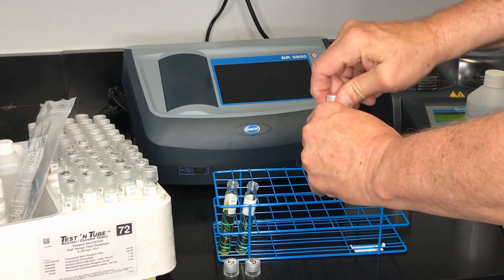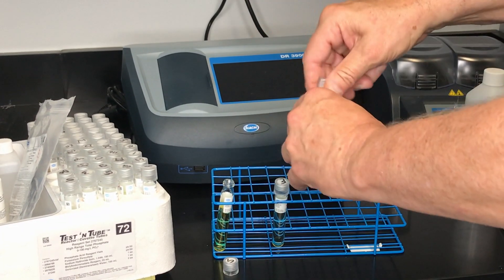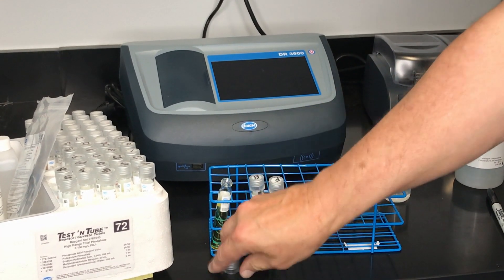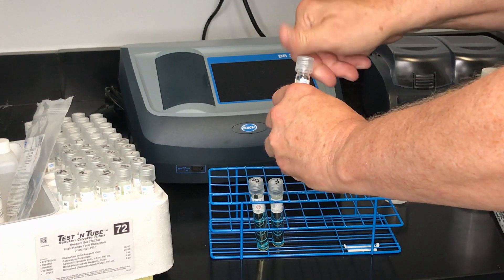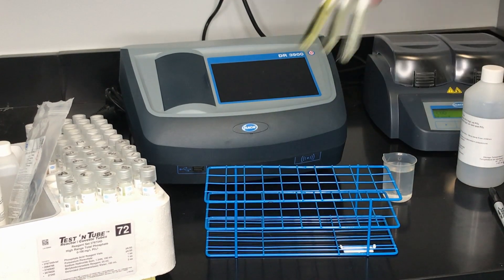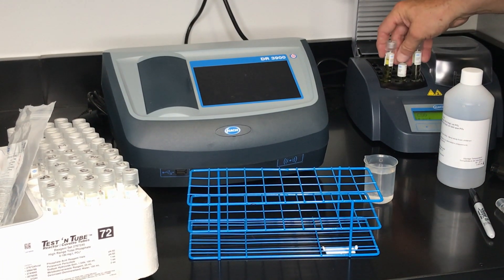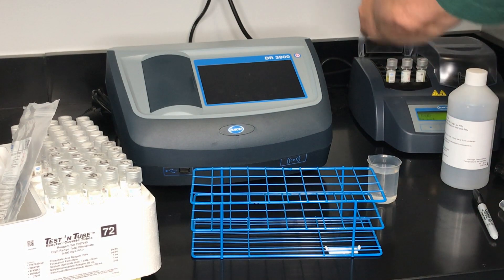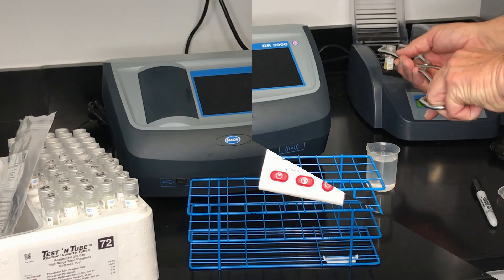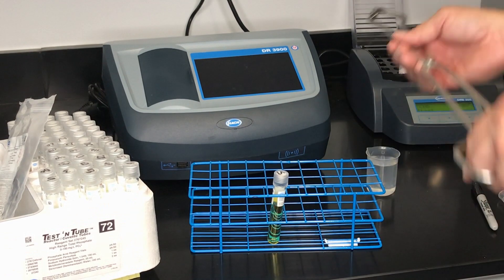Add one potassium persulfate pillow to each vial. Cap and invert each vial two to three times to mix. Insert all vials into the heating block and digest for 30 minutes at 150 degrees Celsius. When finished, remove all vials from the heating block using tongs.